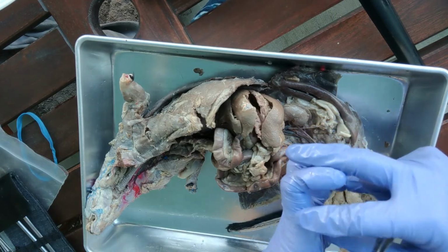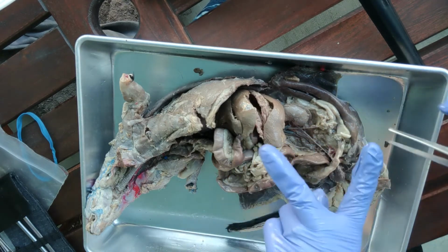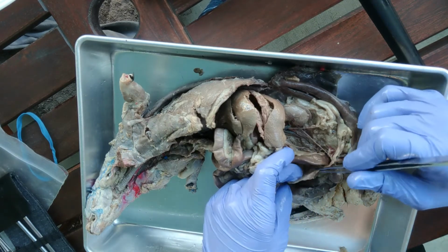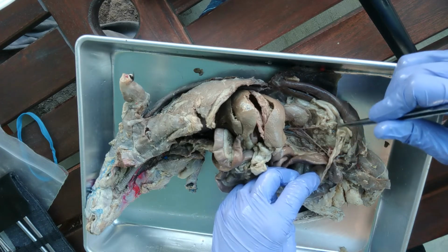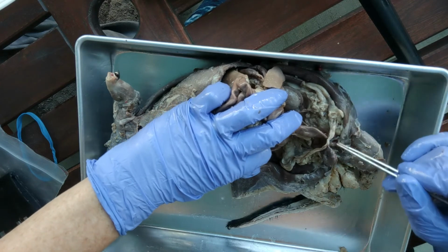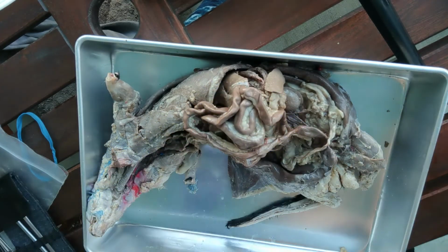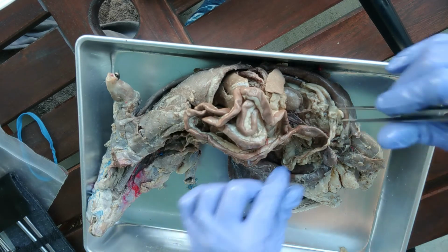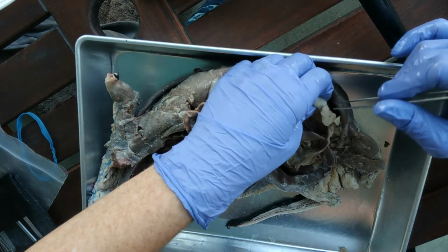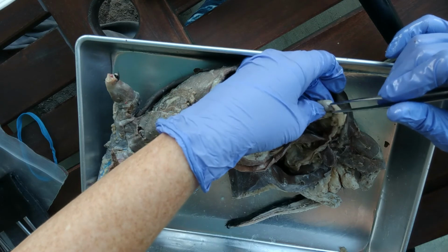Instead of being just one pear-shaped pouch like we humans have, they have more of a Y-shaped structure, and that's called the uterine horn. So one goes this way, and the other one goes that way. And that's why they can have pregnancies on either side, and they can have multiple babies. Okay, so that is the uterine horns, and then the ovaries are going to be tucked nice and neatly at the ends of these uterine horns.